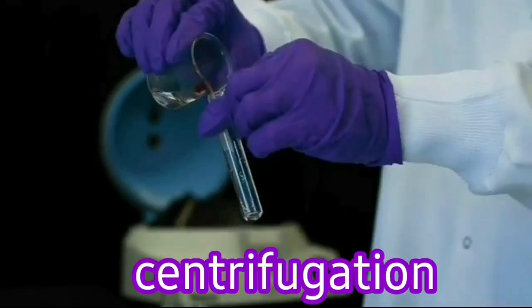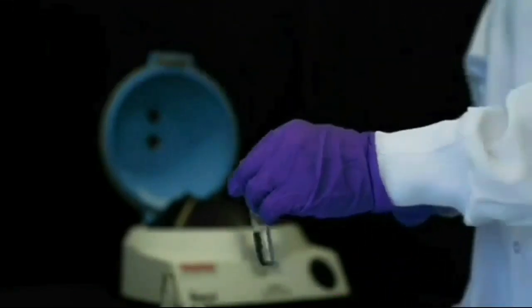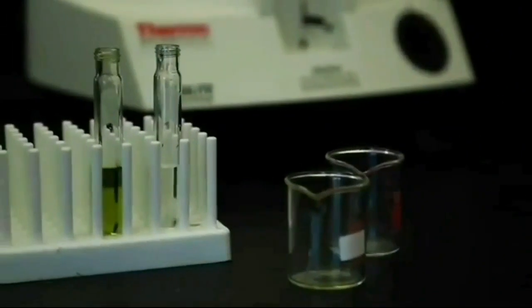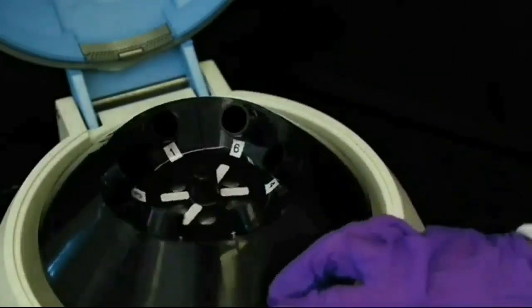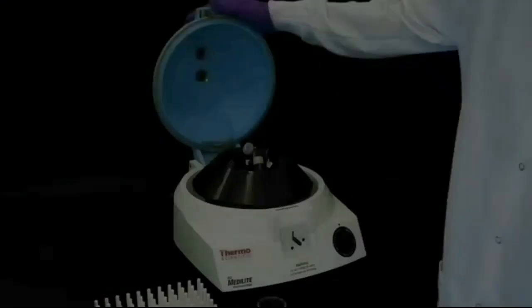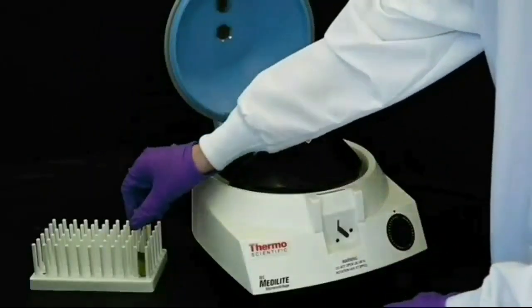This process is centrifugation. Centrifugation is the process by which fine insoluble solids from a solid liquid mixture can be separated in a machine called a centrifuge. A centrifuge rotates at a very high speed. On being rotated by centrifugal force, the heavier solid particles move down and the lighter liquid rises at the top.